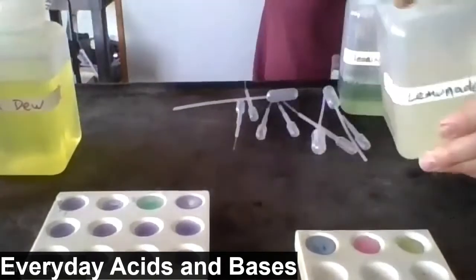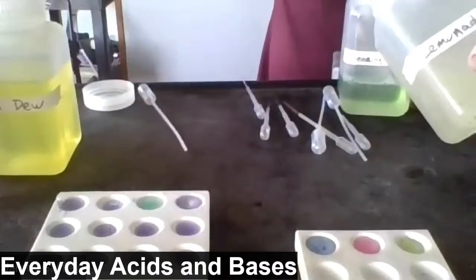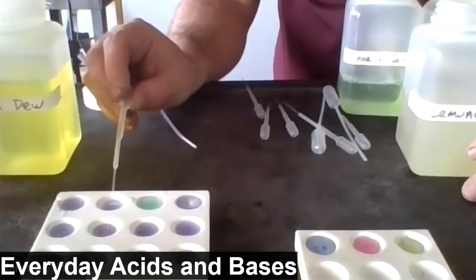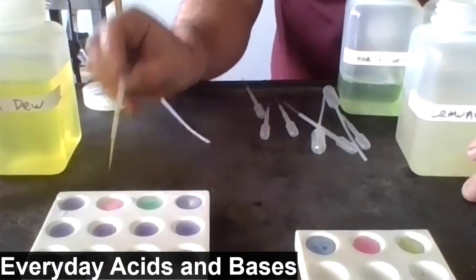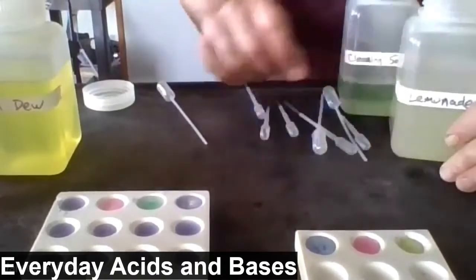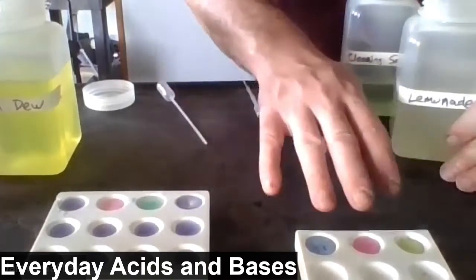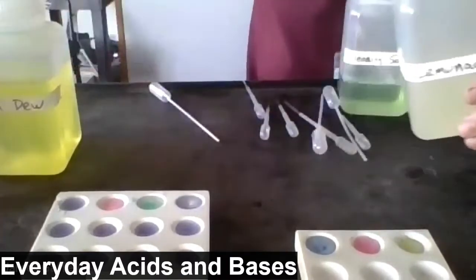Lemonade. I'll add the lemonade to the well next to the ammonia cleaner. Do you see the color? It's reddish, which matches what we see when we added acetic acid to cabbage juice. So that would lead us to believe that lemonade is perhaps acidic.